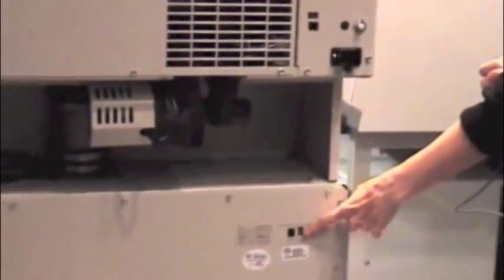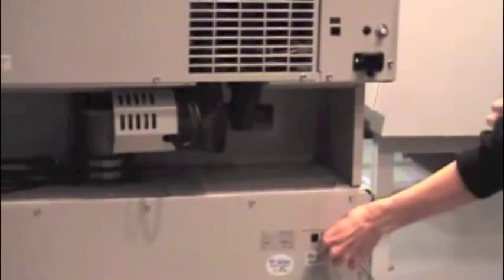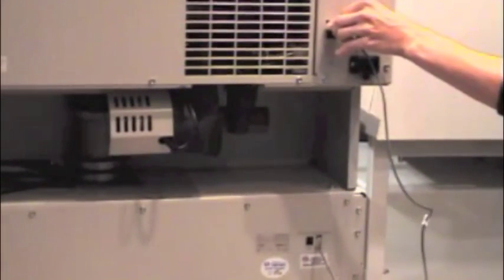On the back of your tray dryer is a port. There's a similar port on the back of the freeze dryer. When connected with the cable provided, the tray dryer can control the freeze dryer's vacuum startup during automatic mode operation.